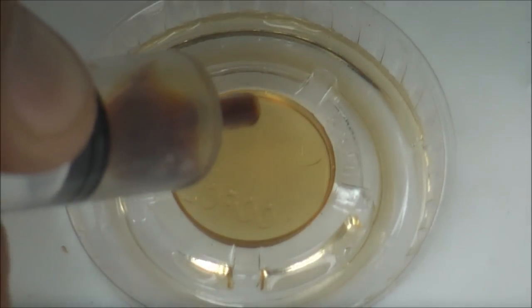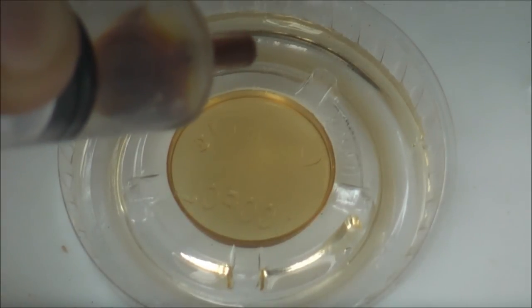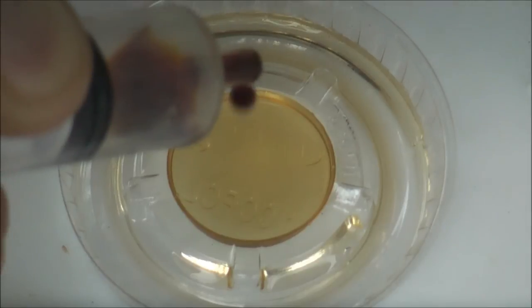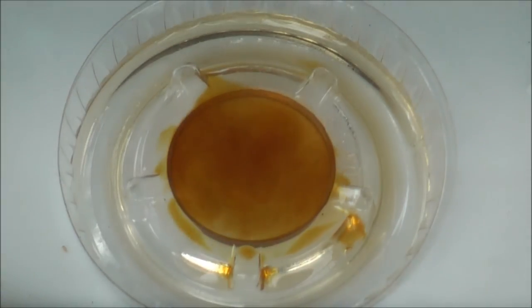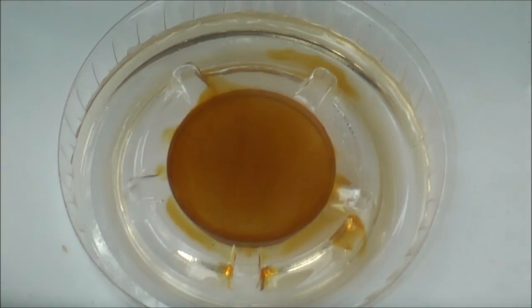Just put a drop on there. Very careful. And I think we're pretty much there.